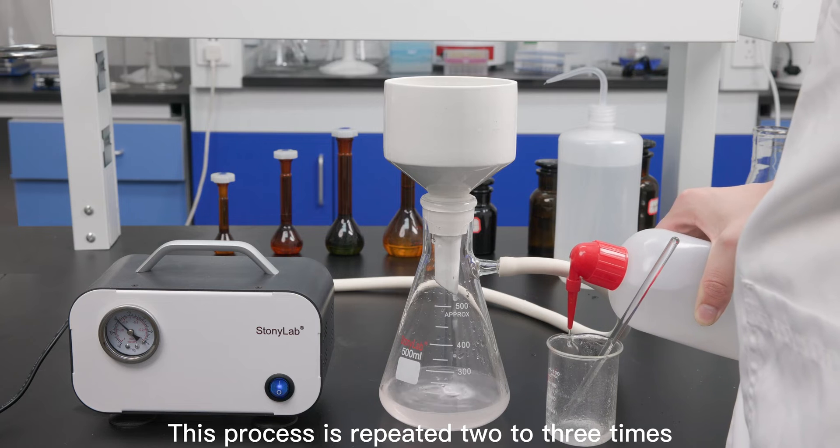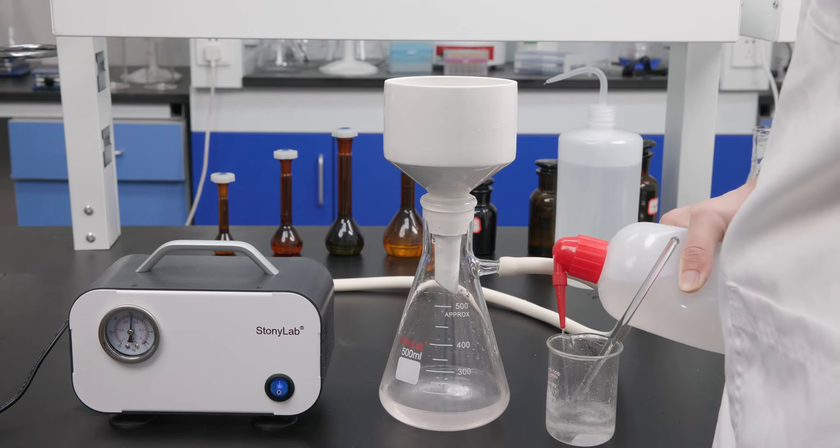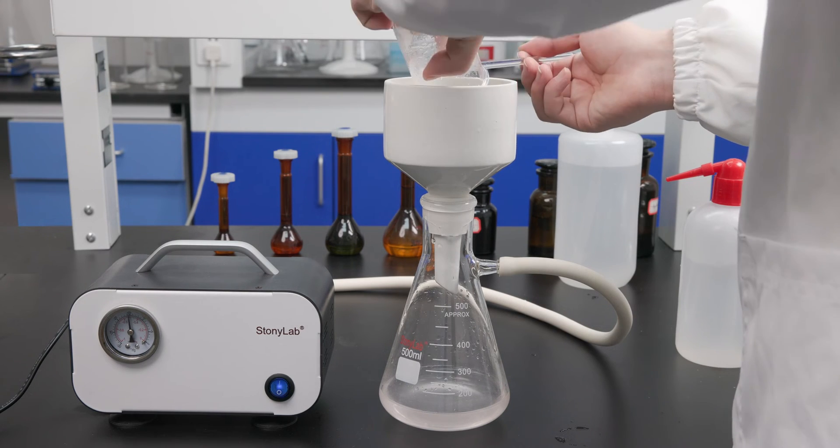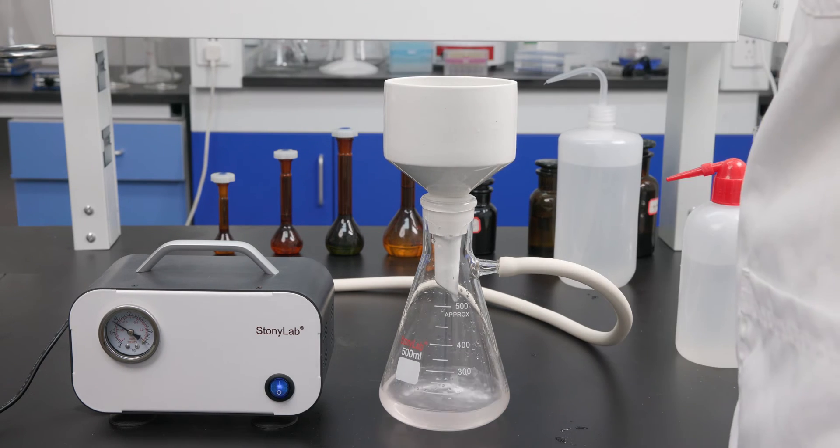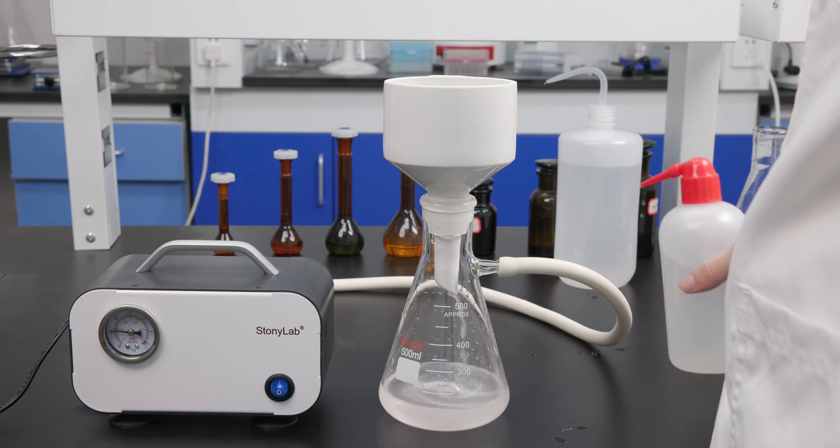This process is repeated two or three times. Finally, the edges of the funnel should also be rinsed with filtrate.